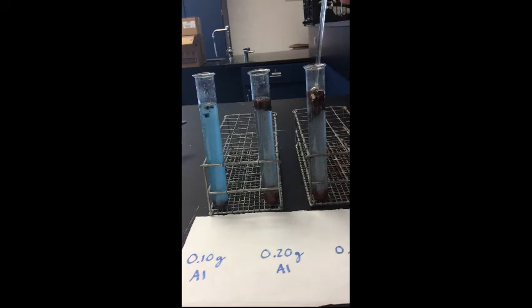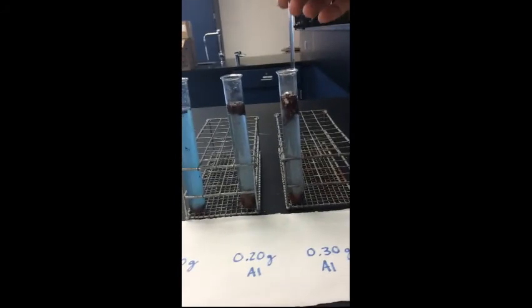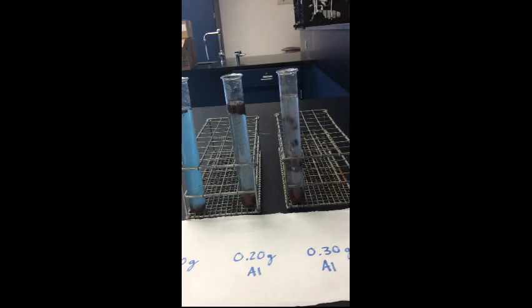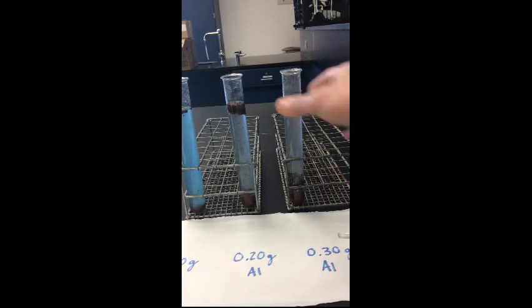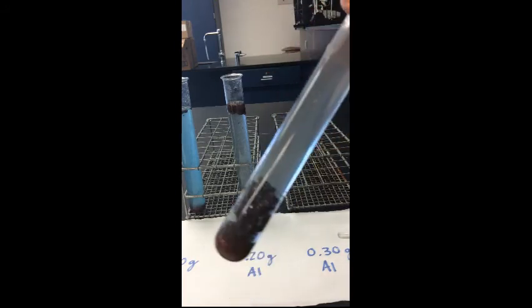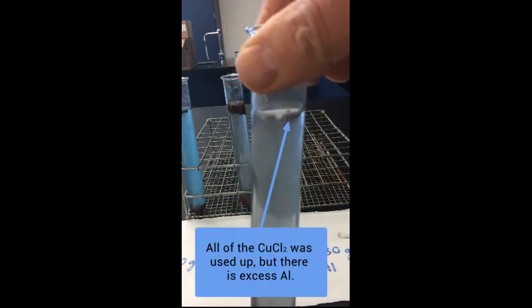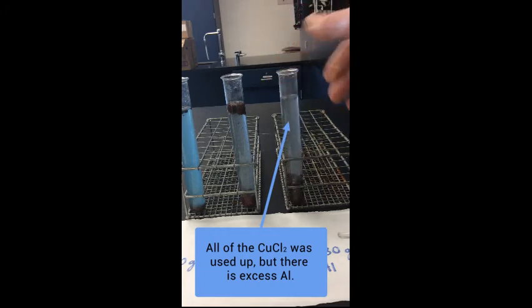Now, if you look at the one that had 0.3 grams, let me just shift this over a little bit. The blue color is pretty much gone. It will be gone in a few minutes, but you notice there's a lot of aluminum still left over, right? So we have excess aluminum, and we used up all of the copper 2 chloride. We made a bunch of copper down here. Let me pick this up and show you a little closer. So we made a bunch of copper, but there's still little bits of aluminum left over. So we had excess aluminum. So this was not a complete reaction for both reactants. We had an excess of aluminum.